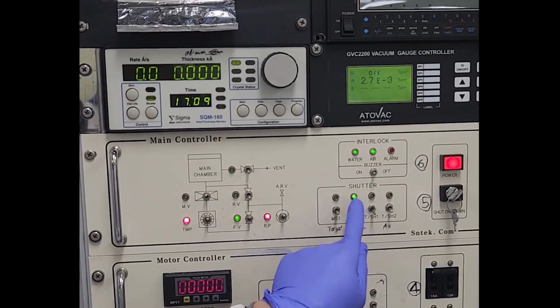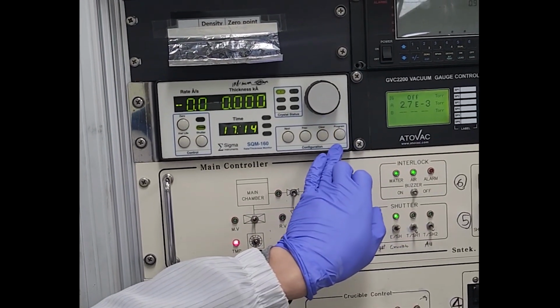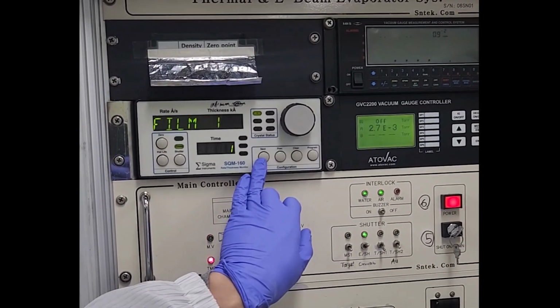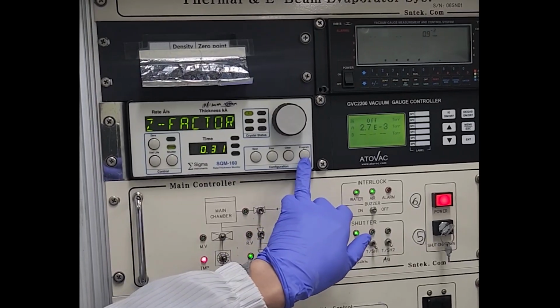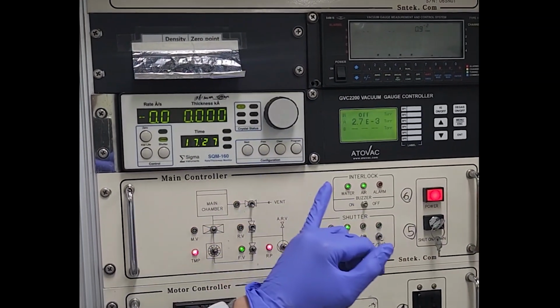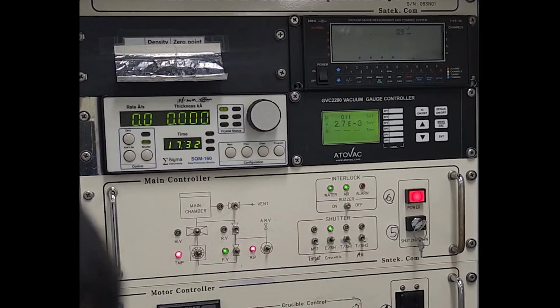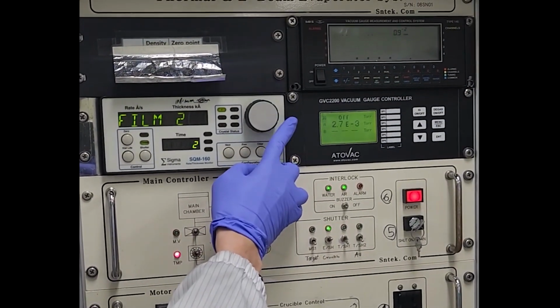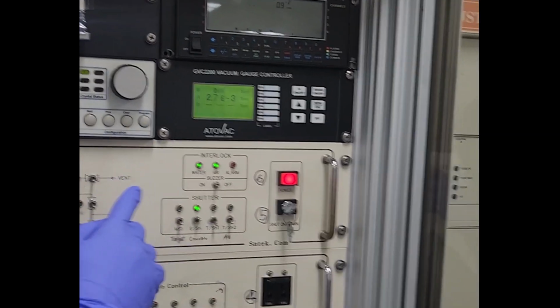Okay, I explain again. First, open crucible and then choose the program, and you should check film 1 or film 2. Choose program again: program, rotate, next to check the information of material and program. If we want to change the program, click program like this, next, and program again. And what about that number here?